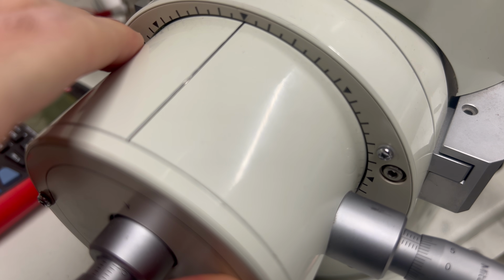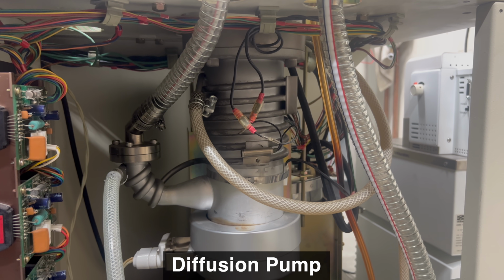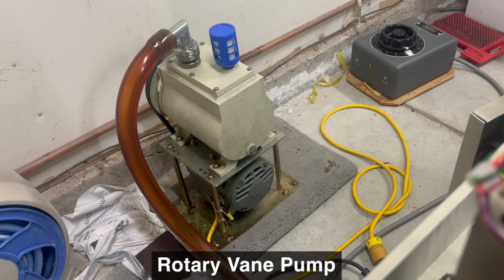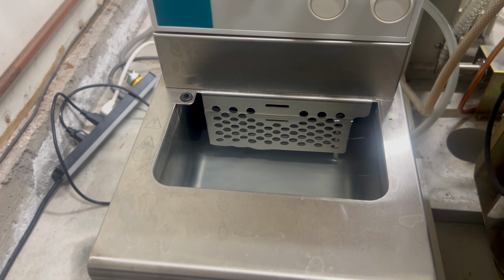To accomplish this, we must use 2 pumps. This is called a diffusion pump. Diffusion pumps are pretty crazy. They have no moving parts and operate entirely by boiling a special type of oil. Diffusion pumps can reach incredibly low pressures. However, they cannot exhaust directly to atmosphere. They can only exhaust into another vacuum pump. Thus, we need a second vacuum pump, just a normal mechanical pump, for that purpose. Diffusion pumps also generate a lot of heat, so they require water cooling as well.